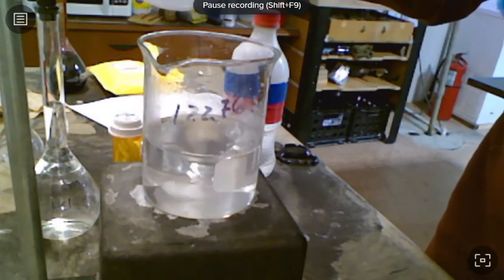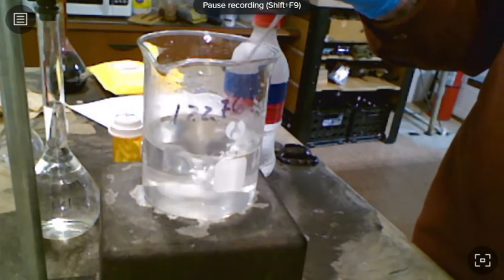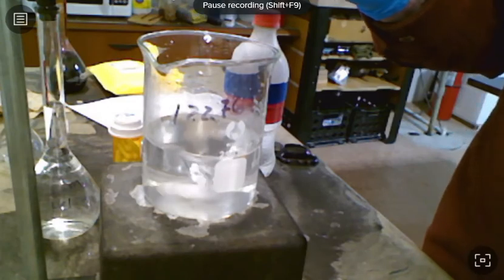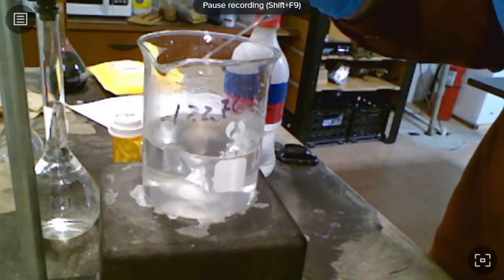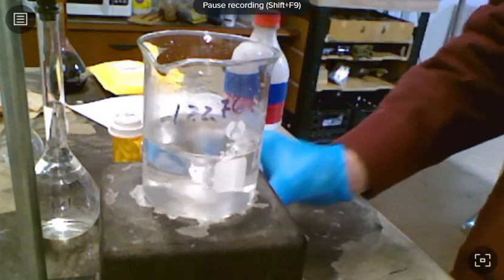And keep in mind, this is a caustic solution, so even the bubbles and the little drips and things that are a part of the pipette, you don't want to be blowing those out anywhere near your face or anybody else's, because they'll burn your skin.